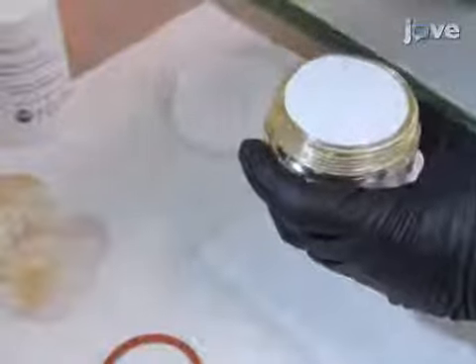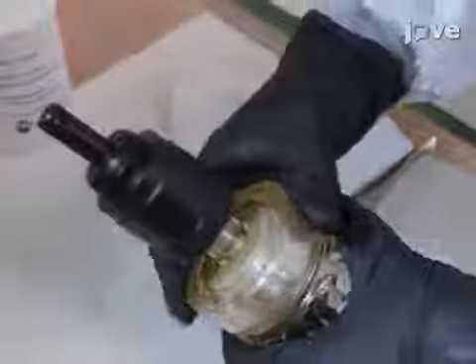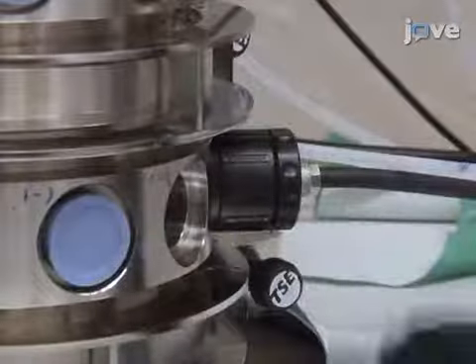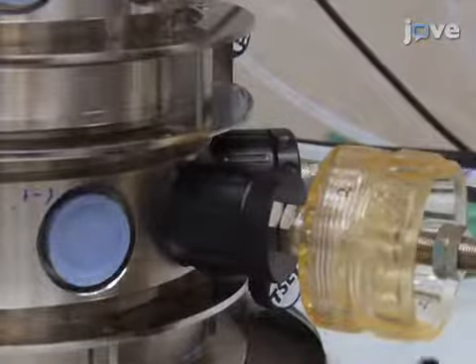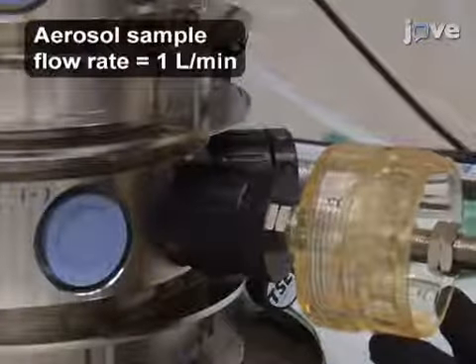First, transfer a pre-weighed filter into the filter holder and assemble the holder. Connect the inlet of the absolute filter holder to a central aerosol plenum sample port and the outlet to a vacuum source.